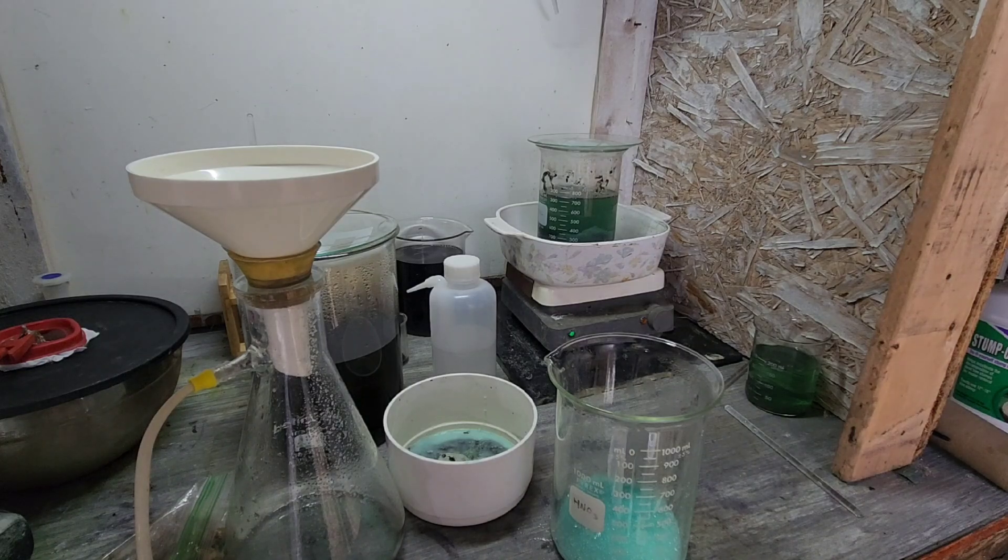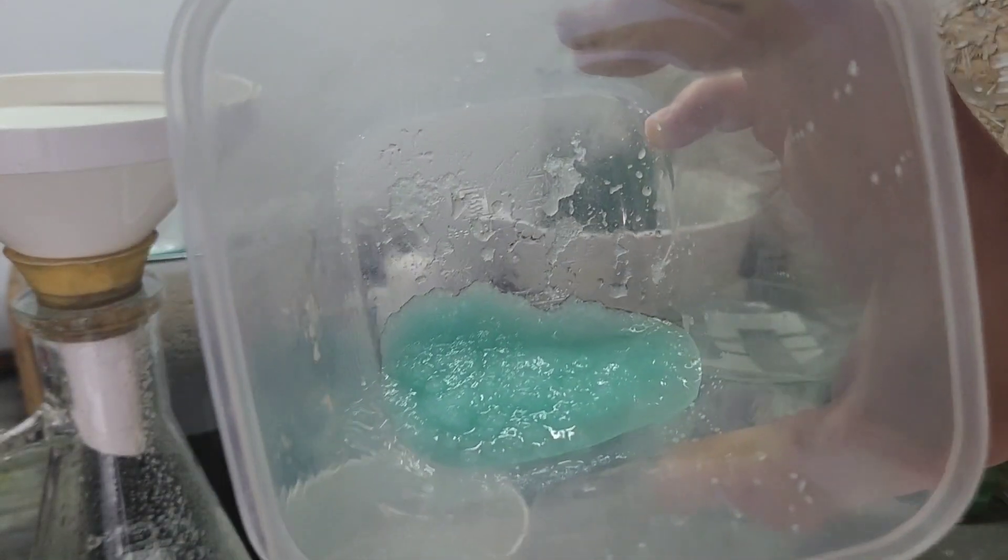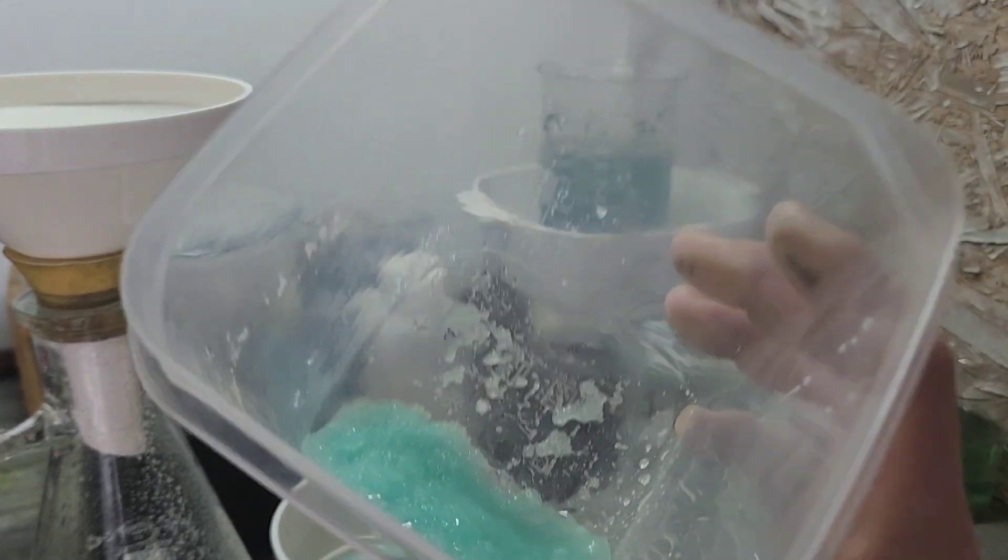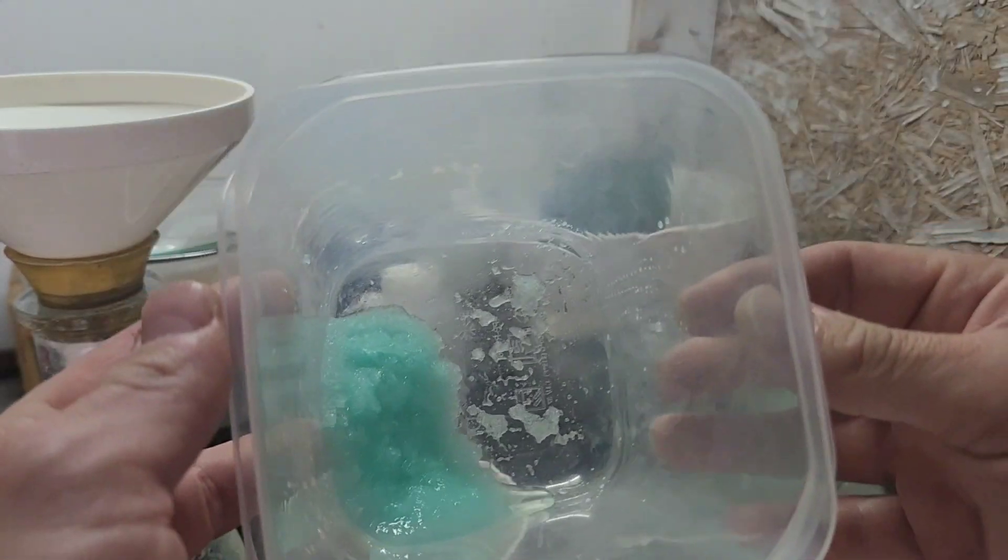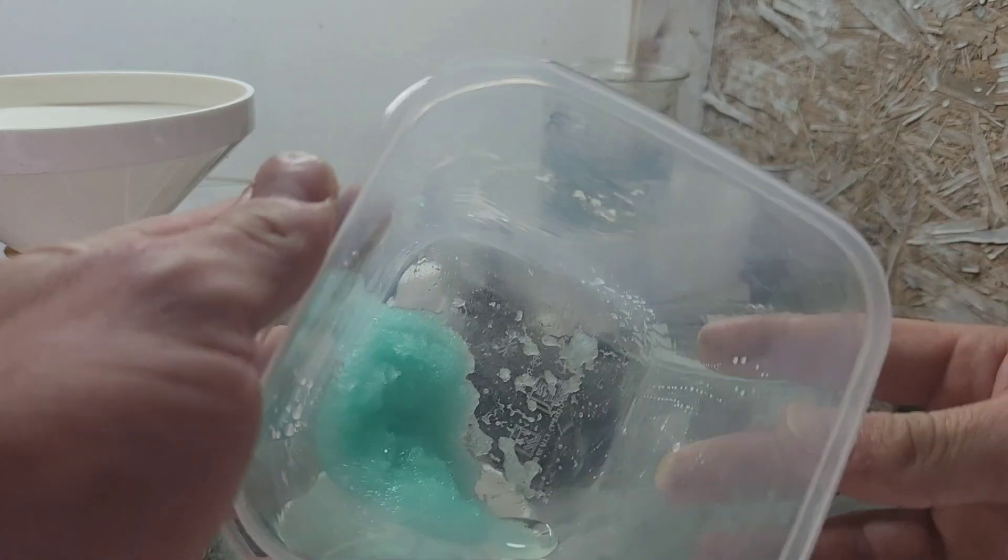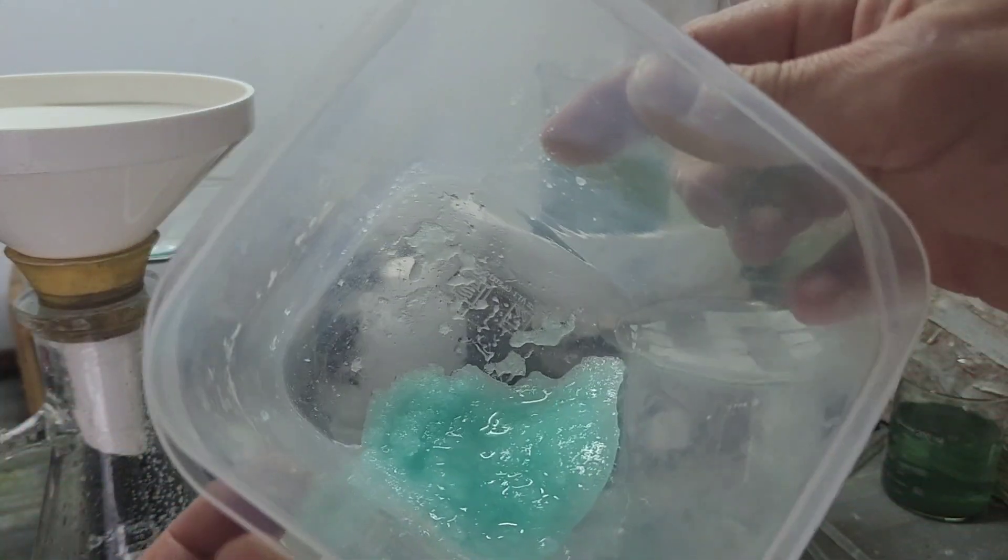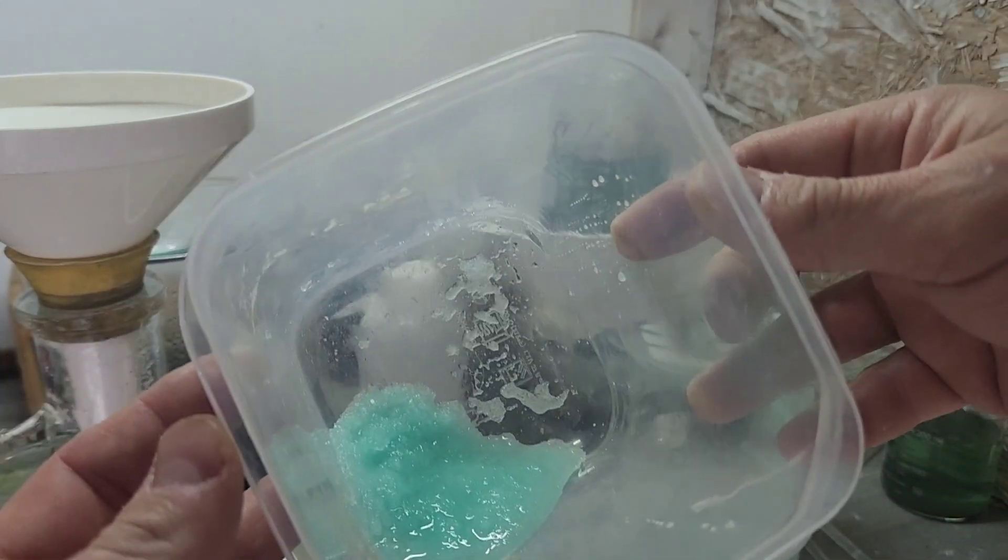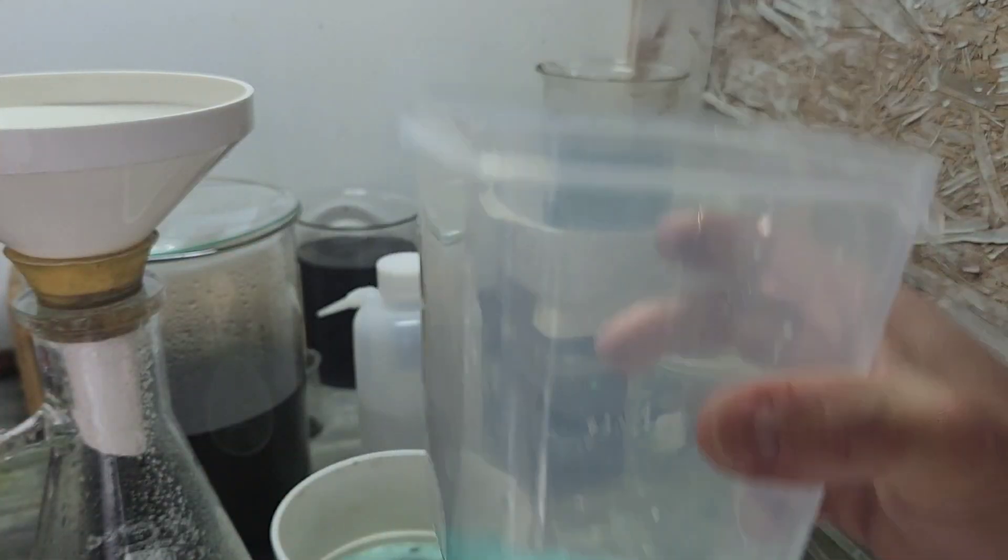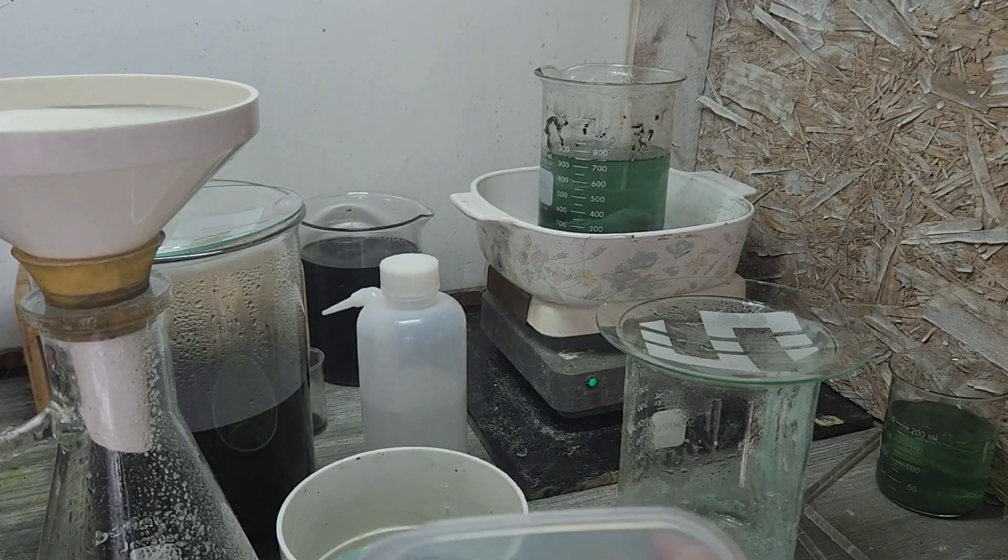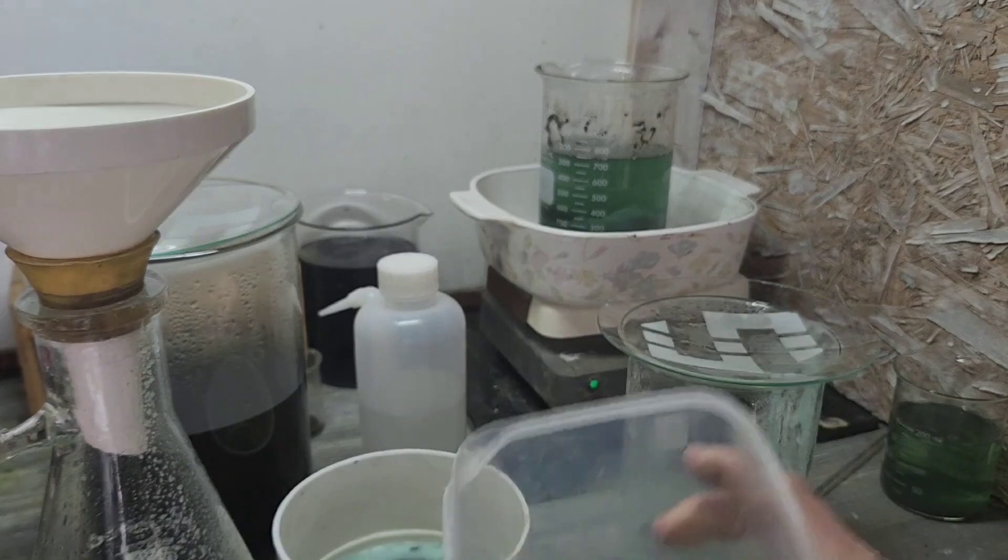So let me break this up and I'll show you a close-up of it. All right, there they are, ferrous sulfate crystals. Got a little bit of moisture left in there. We could probably dry them out, maybe evaporate it for a while. But I'm not going to worry about that until we get as much stuff as we can out of this batch and set us up for our next gold drop.